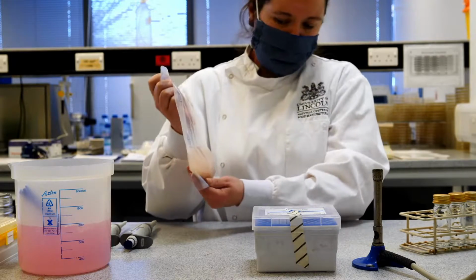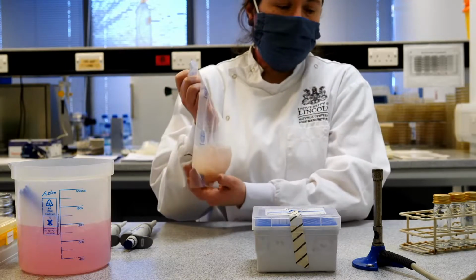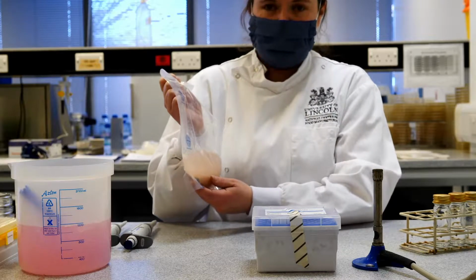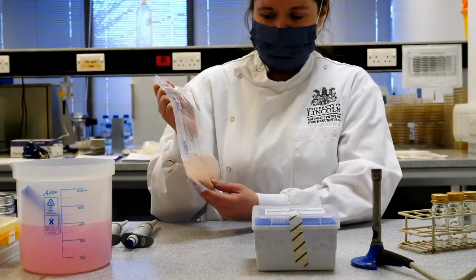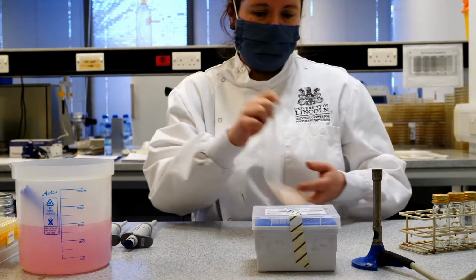So we're going to use these bacteria in suspension. We're going to dilute them down, so in case there are lots of microorganisms in here, we'll dilute them far enough that we'll be able to count them later. So that's the first step. We're going to do a serial dilution.